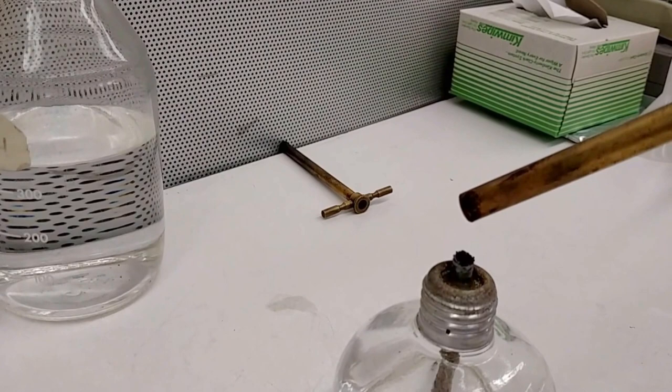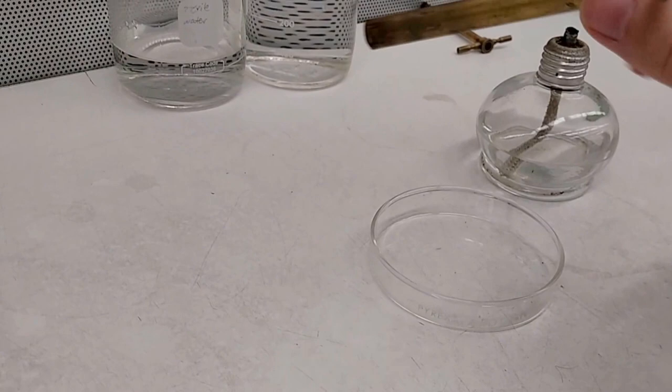This is really good if you don't want to contaminate your samples and also I put it into a petri dish that has already been pre-sterilized with ethanol as well. So I'm just putting that down.